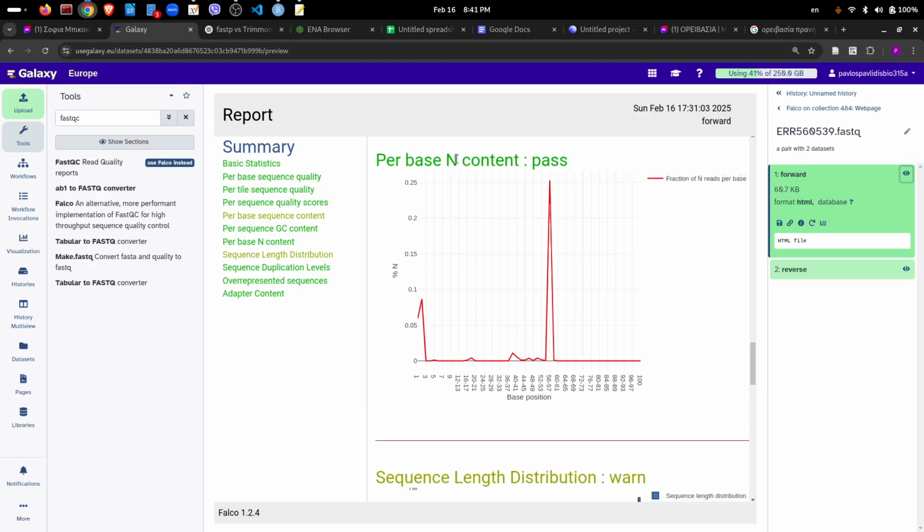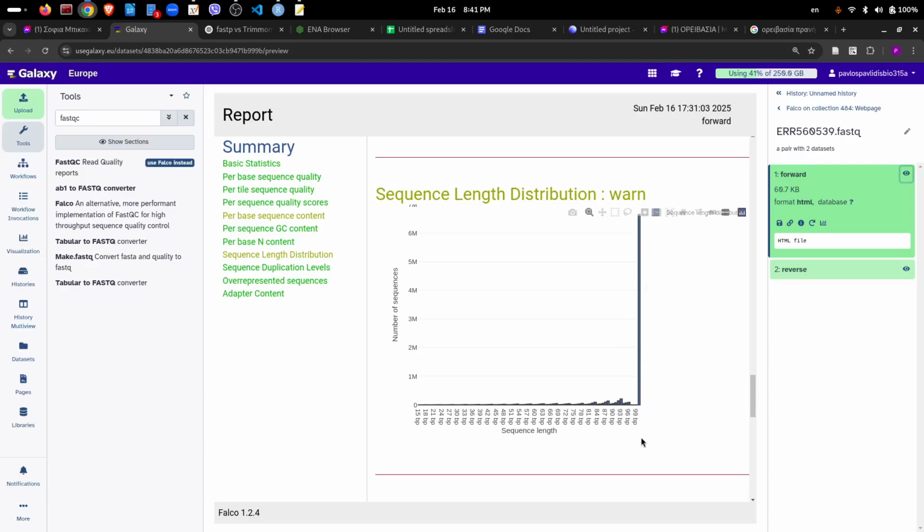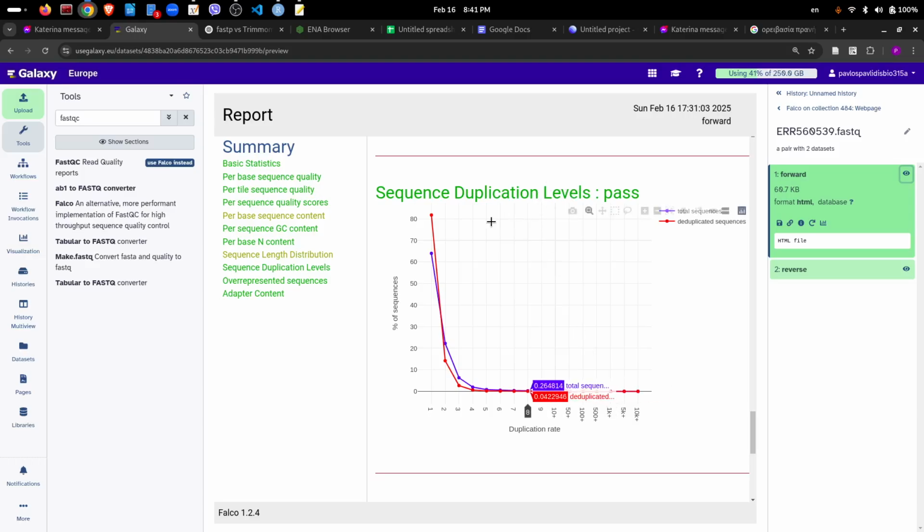We don't have many base pairs that haven't been read along the sequence. The percentage here is very low, 0.25%. For some reason we have slightly higher percentage around base 56 or 57. Regarding the length distribution, most of the reads are 100 base pairs, which is the full length, but due to the trimming we have done here, we have also some sequences that are a bit shorter. We don't have many sequences that are duplicated. Duplicates could indicate a PCR artifact. Here it's fine.